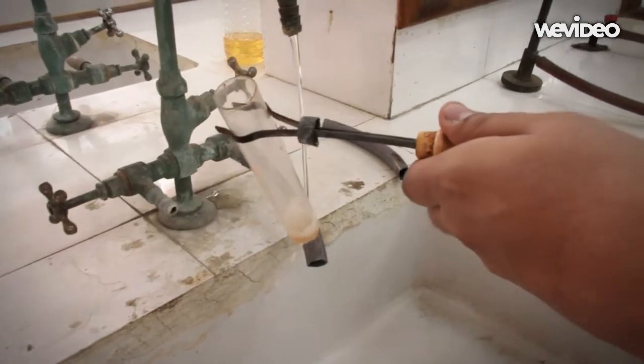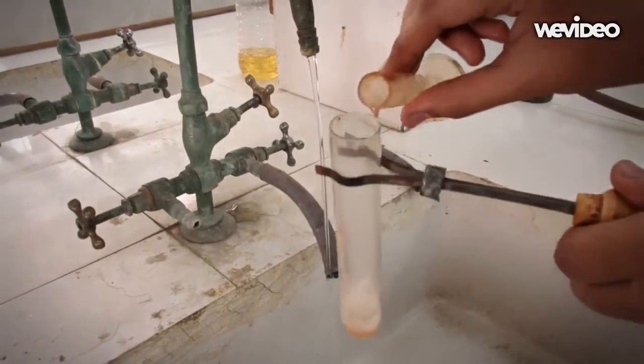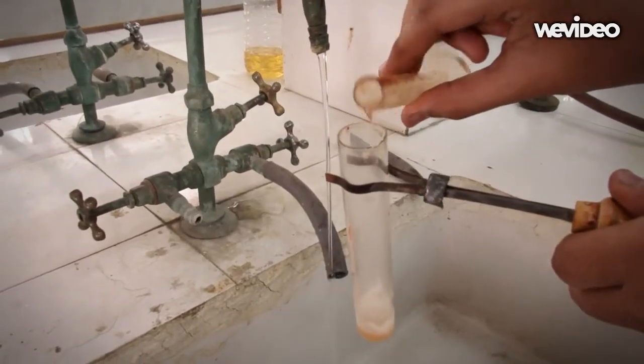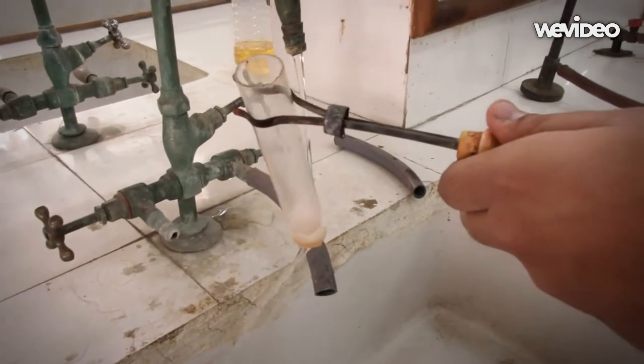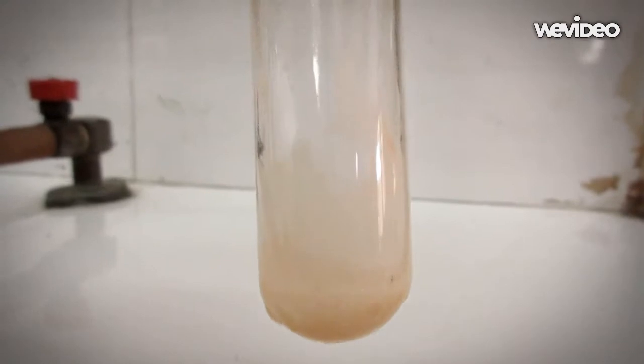After the reaction, the mixture would solidify.